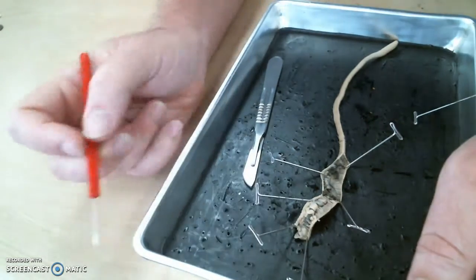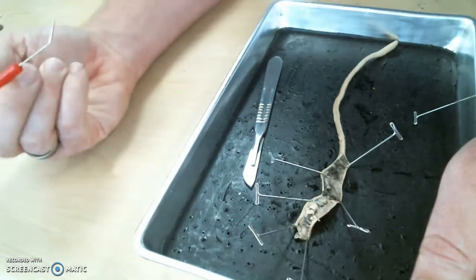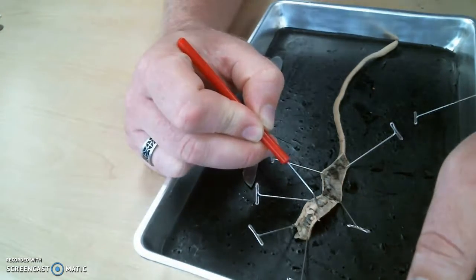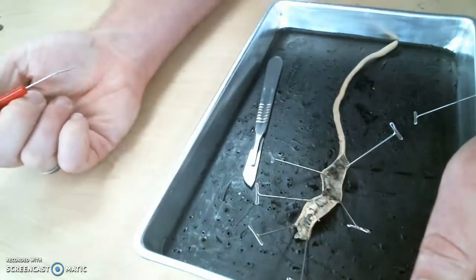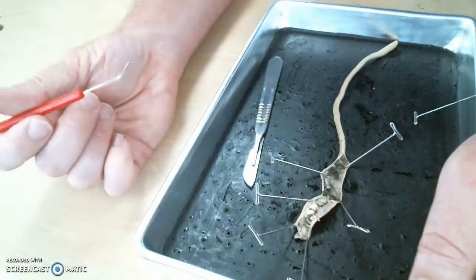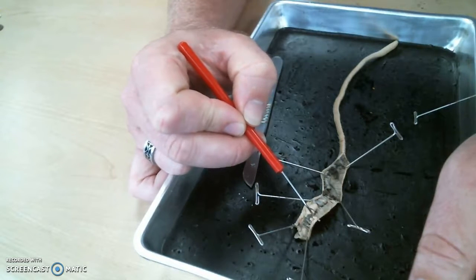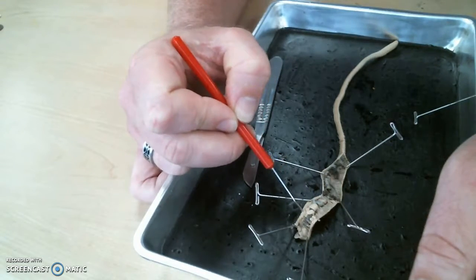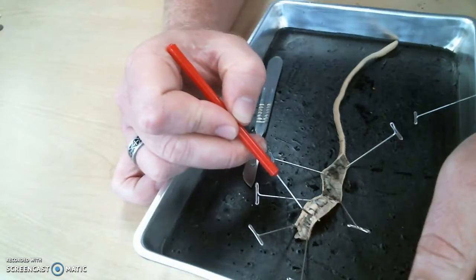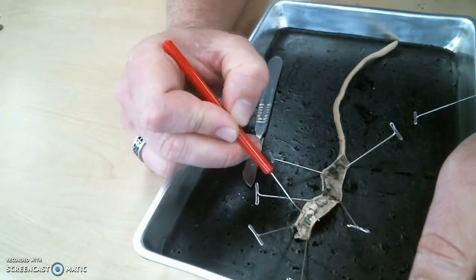So there are structures here that make sperm, and there are structures here that hold sperm from another worm. The larger white organs here, do these make or receive sperm from another worm? They make. Good. These are, and so the ones that make are called the what? Seminal vesicles. Good. And these smaller structures up here, they got stuck to the skin as I was cutting him open. There's another one. I think it's this one right here. Those smaller structures are the seminal what? Receptacles. Good.